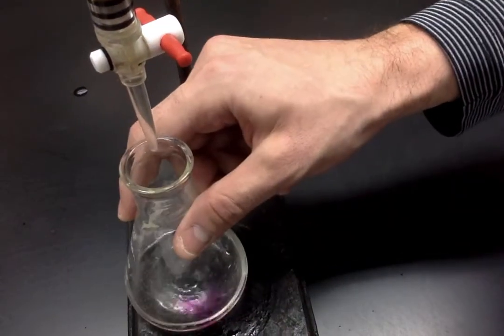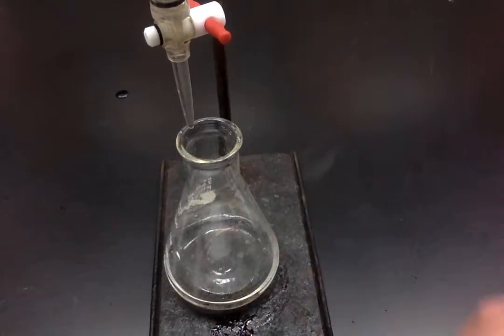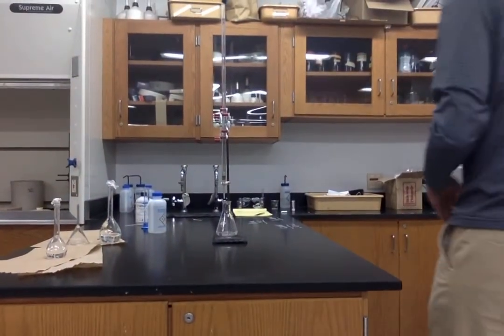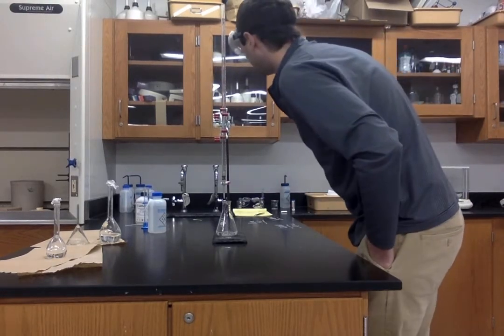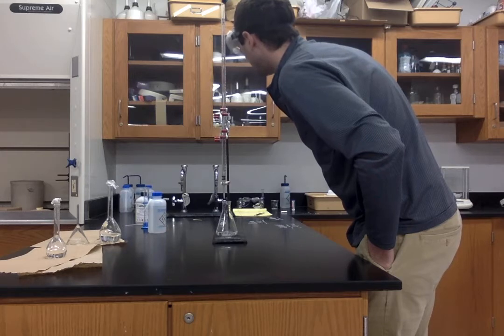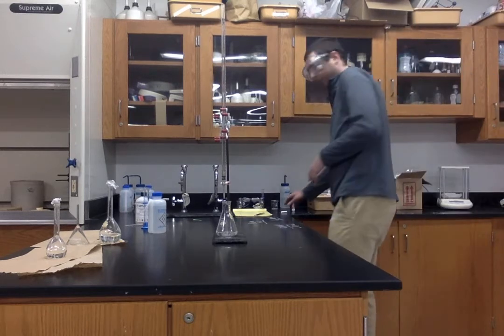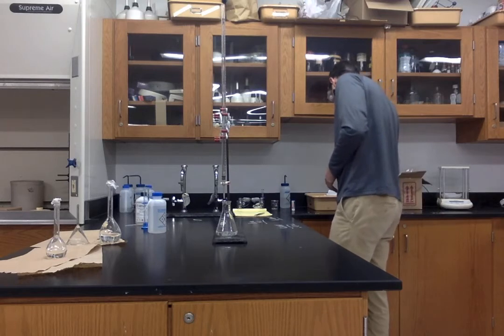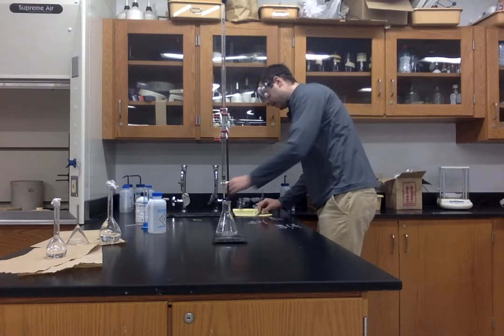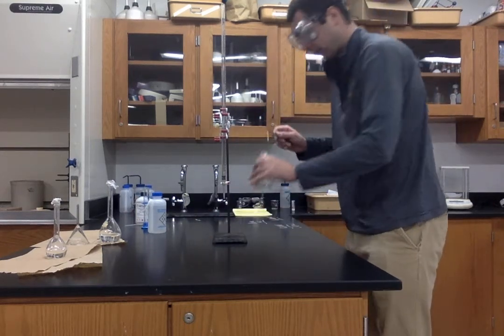Okay, so we've added at this point about 9 milliliters of base. What I'm going to do, let me back you up here, is simply test the pH again. So I've added, what are we at? We're at 9.20 milliliters. I'll have this all on the document that you're writing down. I'm just going to jot it down. So 9.2 milliliters of NaOH has been added. Let's take a look at our pH using a test strip.